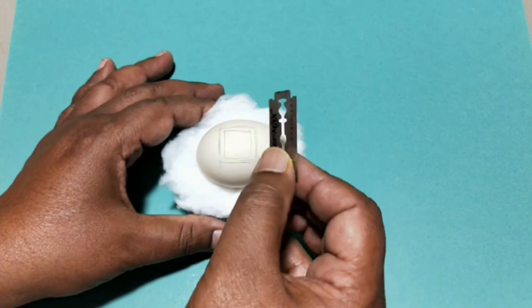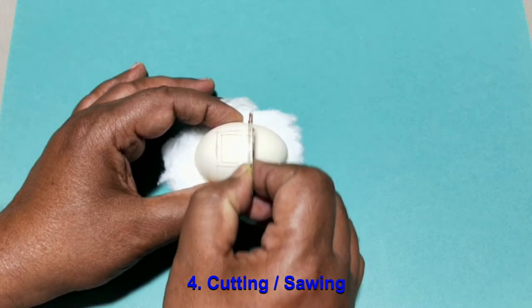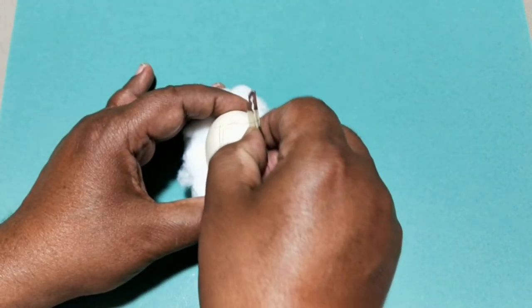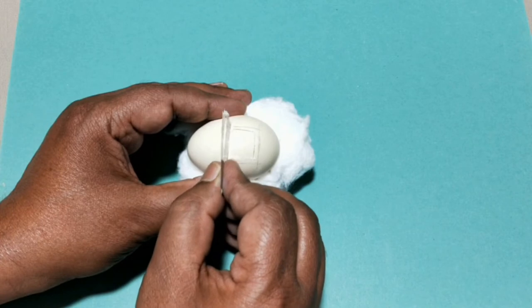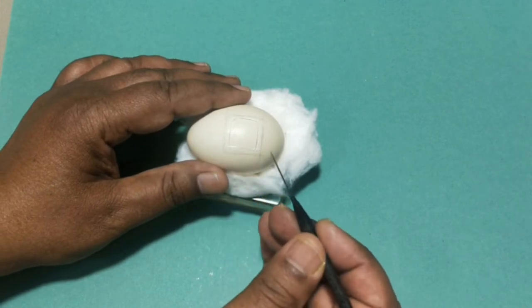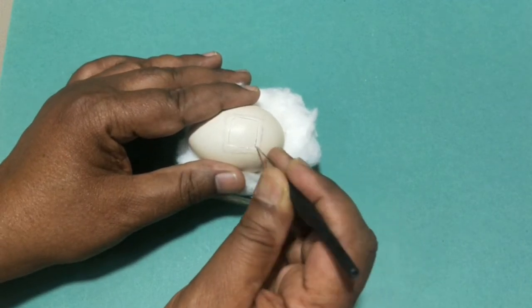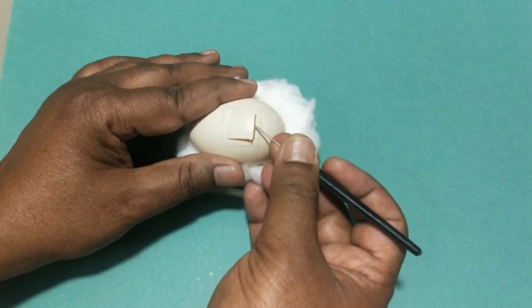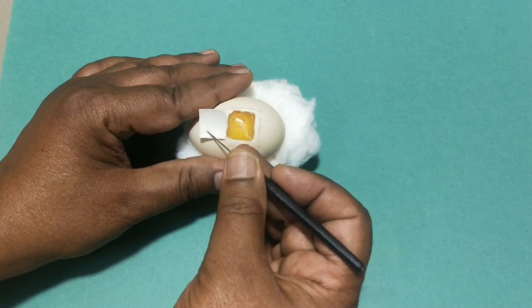Now, cut the eggshell along the inner square by gently sawing with the blade. Use a pointed forceps or needle to remove the cut piece of the shell in such a way that the shell membrane remains intact. This membrane prevents the falling of wax on the embryo. However, it got cut here.